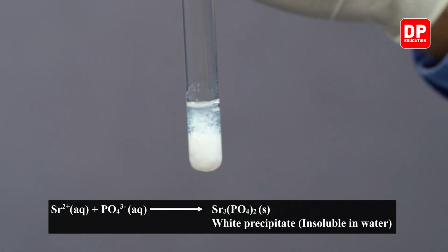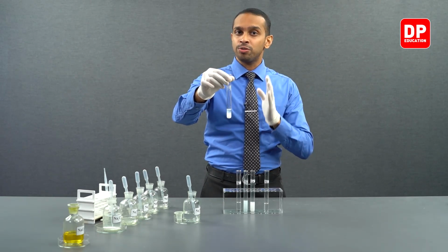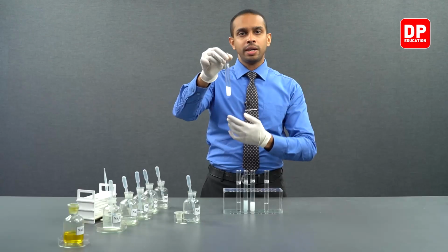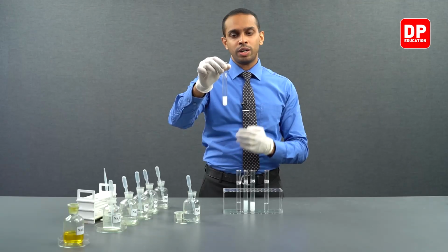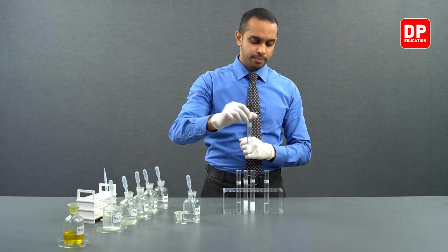So when strontium 2+ ions come into contact with phosphate ions, they form strontium phosphate, a white color, water-insoluble precipitate. If I shake it, these precipitate particles will be suspended in the aqueous medium, forming a white color suspension here. So what is the color of strontium phosphate? It is a white color, water-insoluble precipitate.